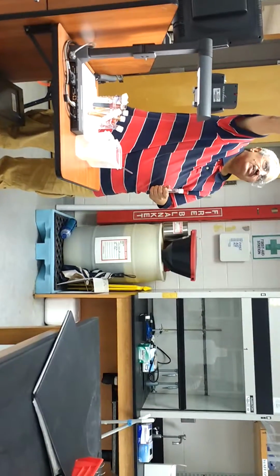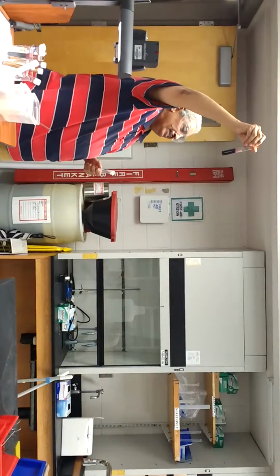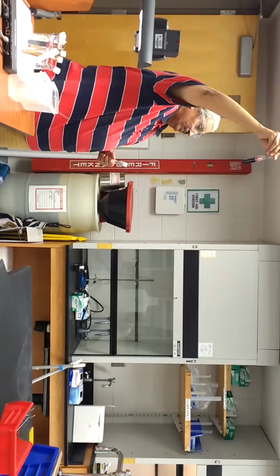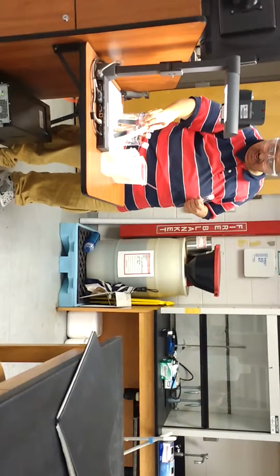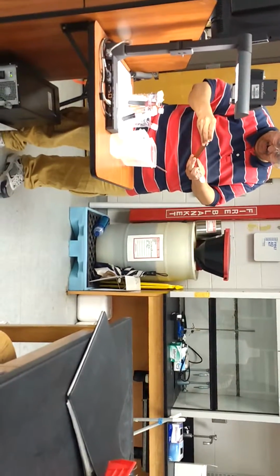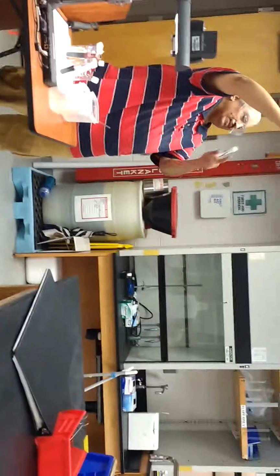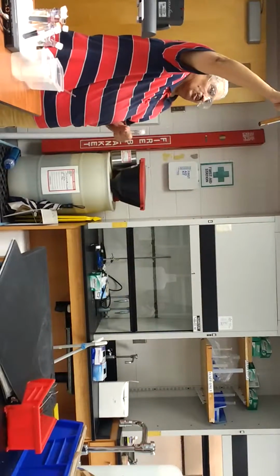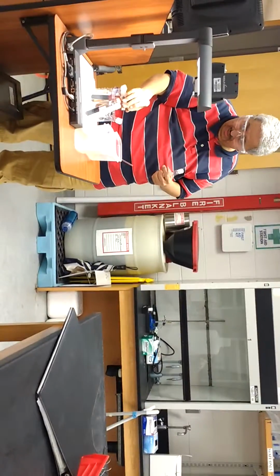a light, you can see there is a crystal at the bottom, but it's very hard to see because it's very dark. Cyclohexane is a non-polar solvent and permanganate is polar, so they don't mix. They don't mix. So then I take cyclohexane with permanganate. That's the permanganate. You can see here, it's very nice. Permanganate is not soluble. The permanganate is settled down at the bottom, correct?